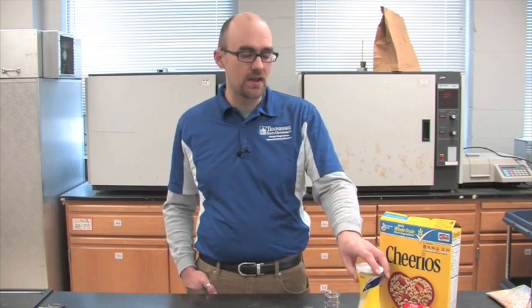The different types of materials we're going to use include two types of cereal. One is regular Cheerios, which has about one gram of sugar per serving. We've also got a higher sugar cereal, Fruit Loops, which has about 11 grams per serving. We have regular sugar and also switchgrass products. The point of the activity is to show how sugars can be converted into ethanol using yeast.